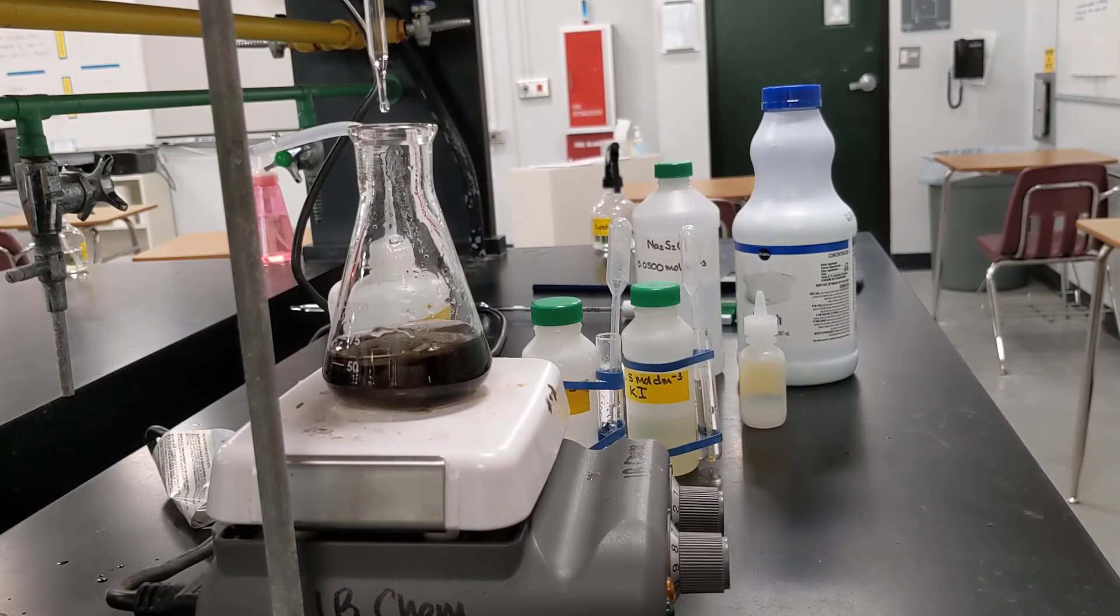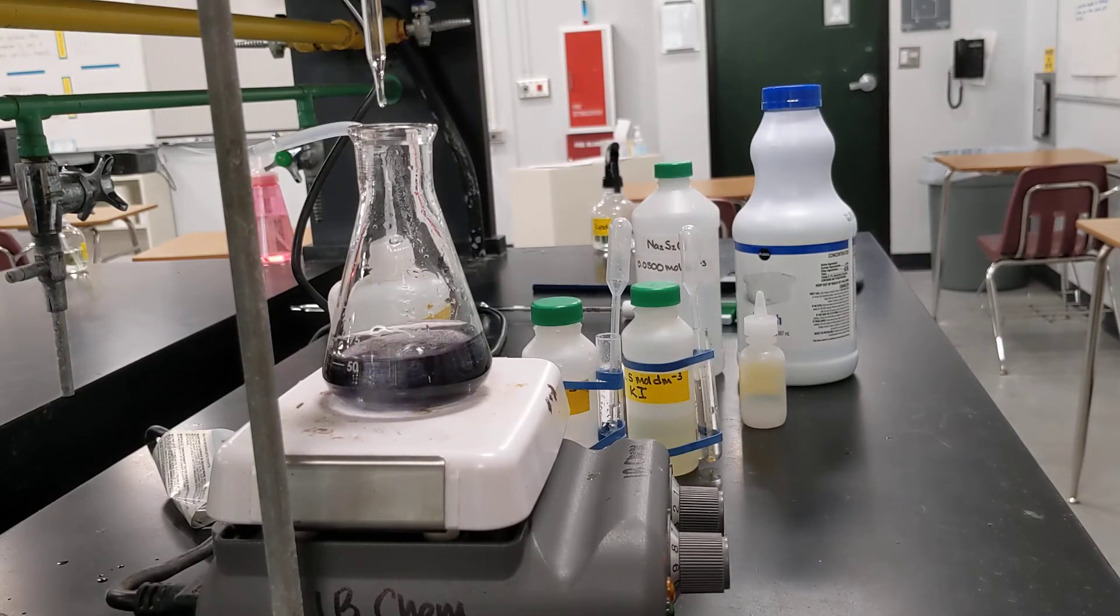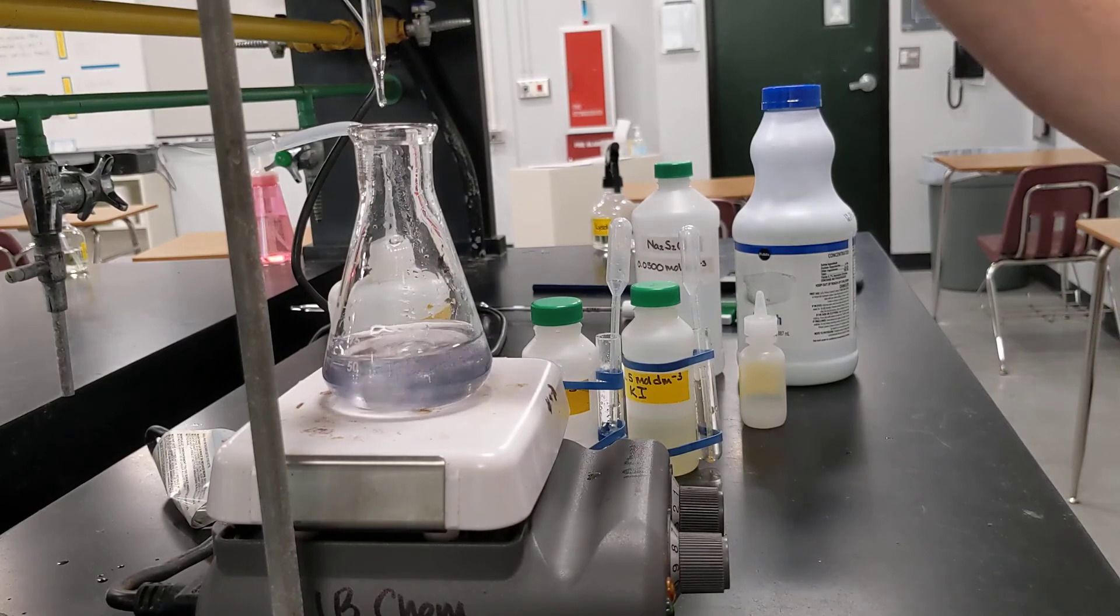And this will make that last little bit of iodine reacting easier to see when we reach the end point here. So now I'm going to be careful, and I'm just going to let this go in drop by drop. And again, color's starting to lighten. It's kind of a light purple. And we're getting close now.